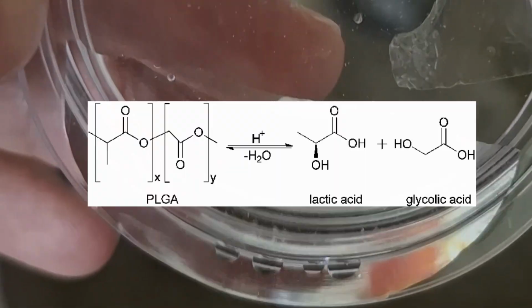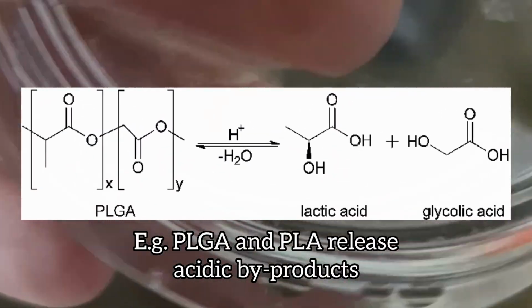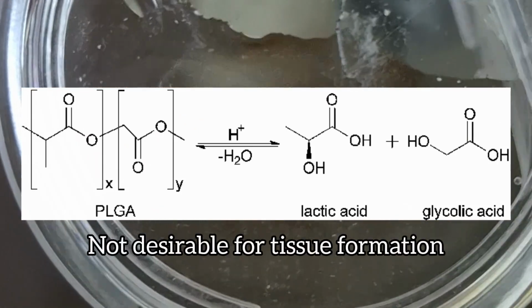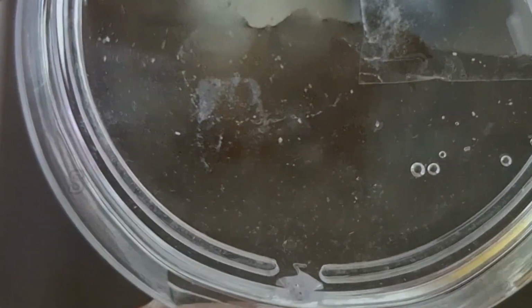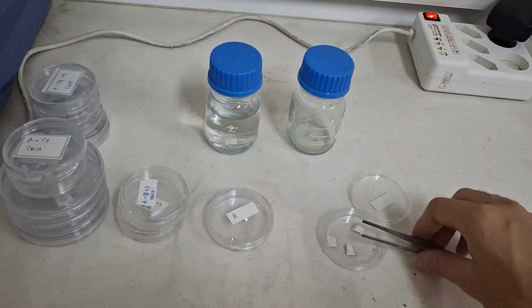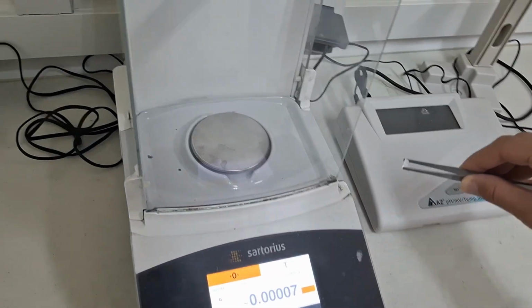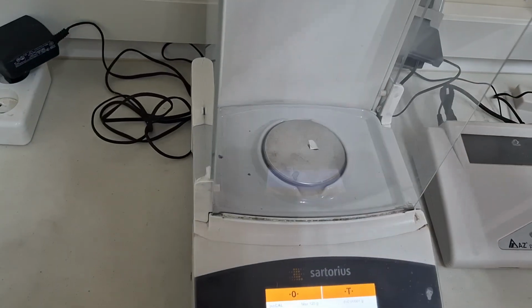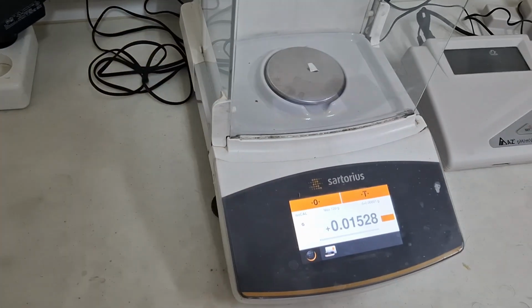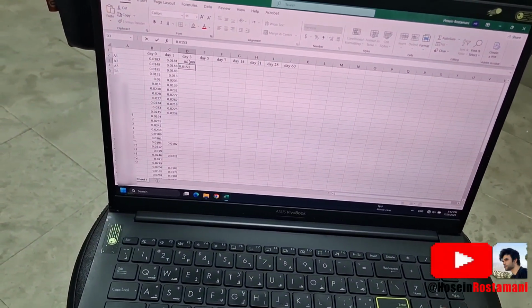This allows you to see whether the byproducts released from the scaffolds are making the medium more acidic or more basic. Whenever you reach one of the predetermined time points, first measure pH of each sample in its medium. Then remove the scaffolds from the containers, dry them, and weigh them. In the Excel file I mentioned earlier, record the weights under the corresponding day. After you finish, return the scaffolds to the degradation medium.